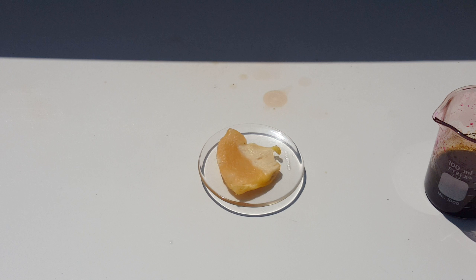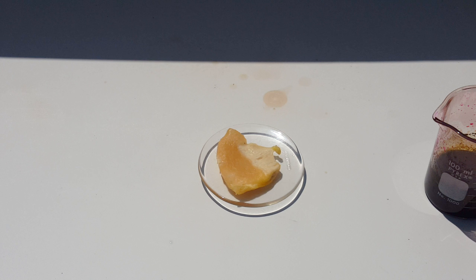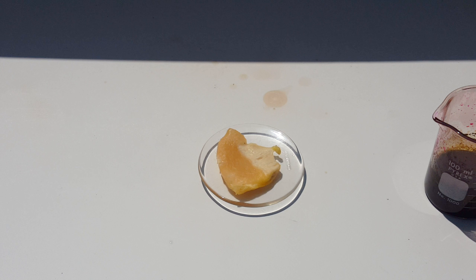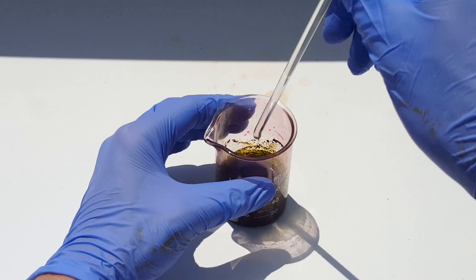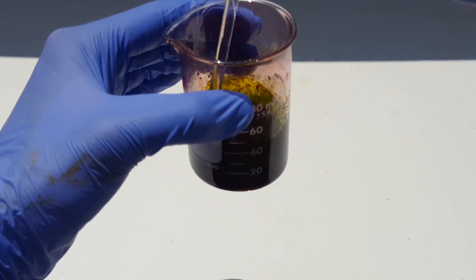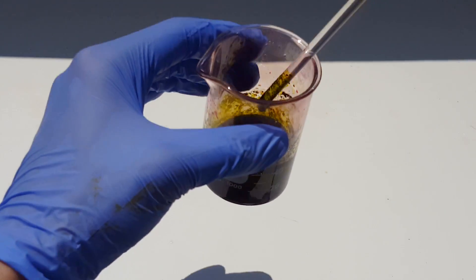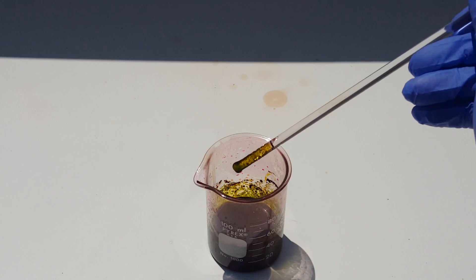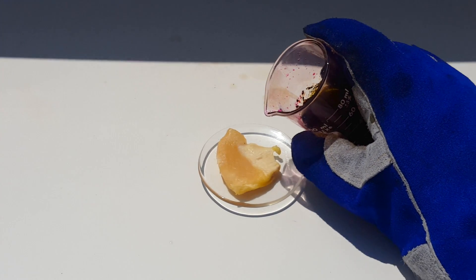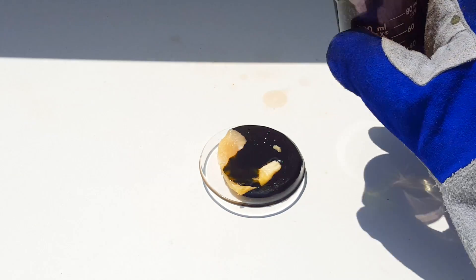Now for the grand finale, I decided to try to replicate what might happen if you managed to spill a bunch of Manganese Heptoxide onto human flesh. To do this, I'll be using a piece of chicken breast. I actually created about 25ml of Manganese Heptoxide in a small beaker — I highly advise against doing this, as the breakdown of the compound is far quicker in this quantity and it could result in an explosion. After laying out the chicken, I poured on about half of the solution and let it sit. Here's a timelapse of what happened over the course of about 7 minutes.